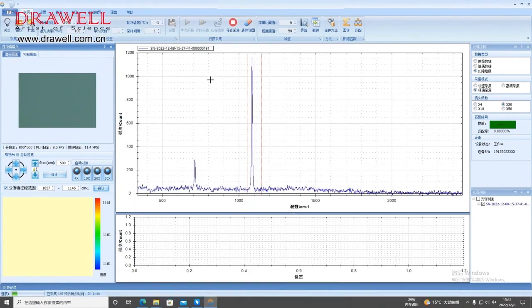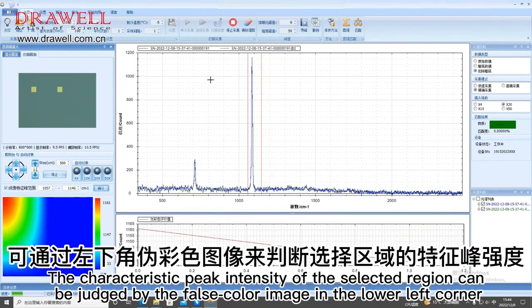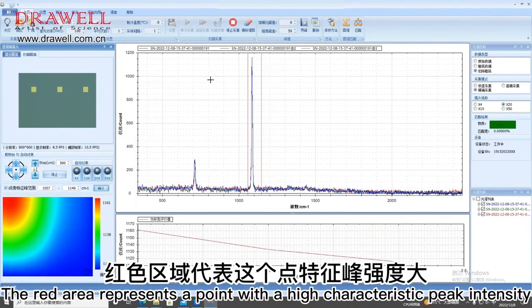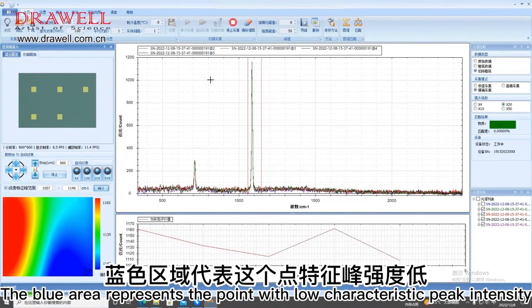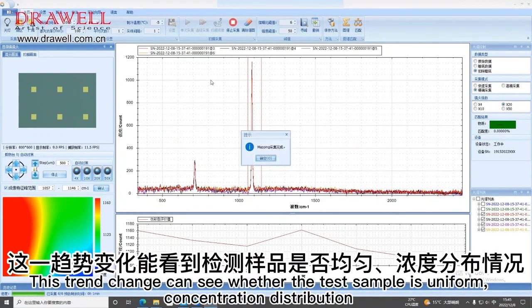The characteristic peak intensity of the selected region can be judged by the false-color image in the lower left corner. The red area represents a point with a high characteristic peak intensity. The blue area represents the point with low characteristic peak intensity. This trend change can show whether the test sample has a uniform concentration distribution.